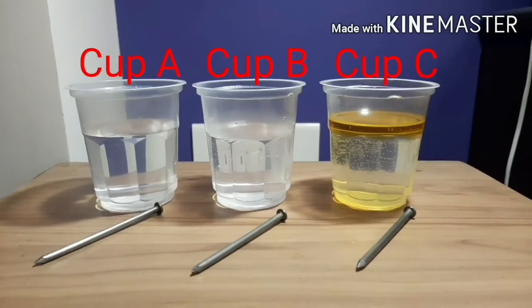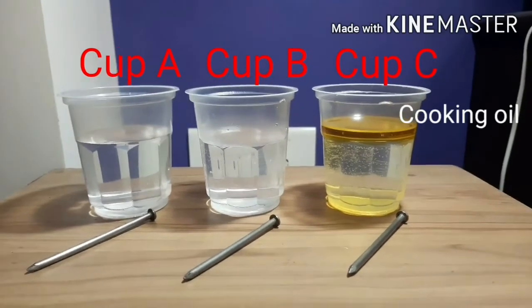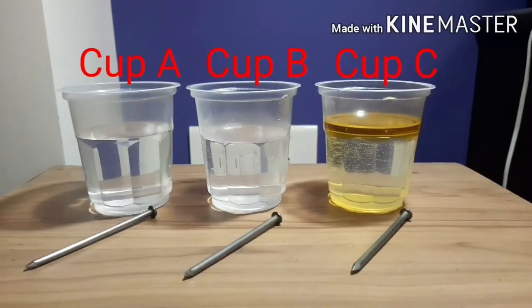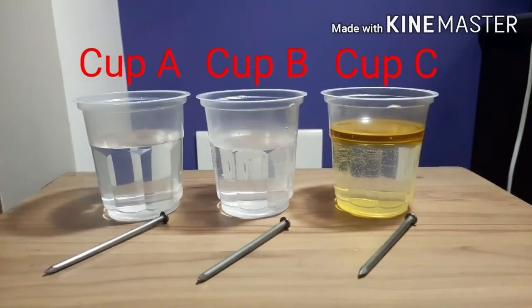In cup C, I have taken again the boiled tap water plus I have added cooking oil in it. You can see that cooking oil is floating on water and it has formed a layer on the surface of water. Okay, is it clear?